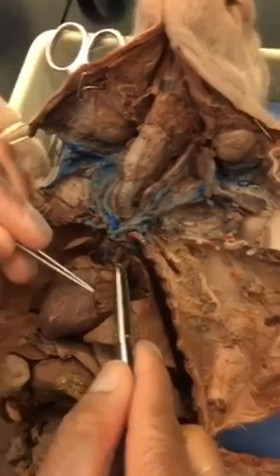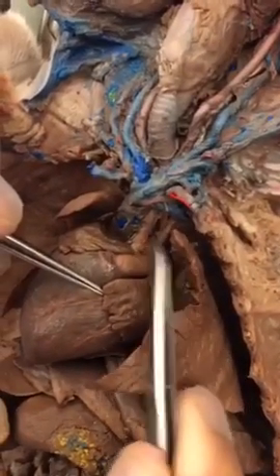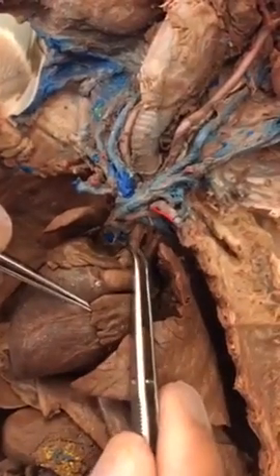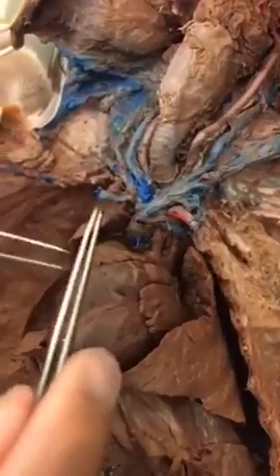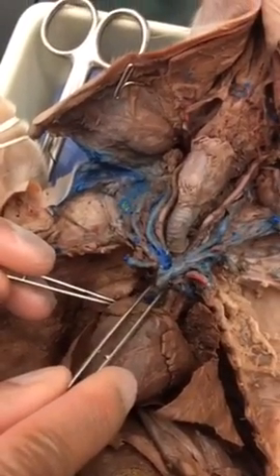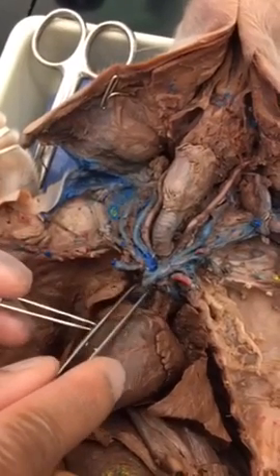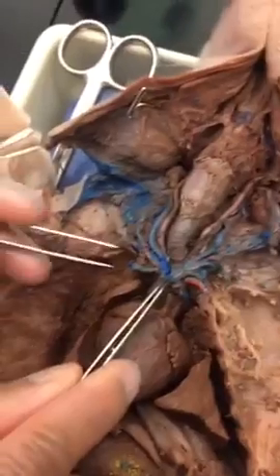Now, brachiocephalic trunk is going to be the first one coming out from the aortic arch. This is the aortic arch, the very first one, brachiocephalic trunk, or the artery. Brachiocephalic vein is going to be right above the superior vena cava, exactly the V, right in the middle, before it turns into branches.